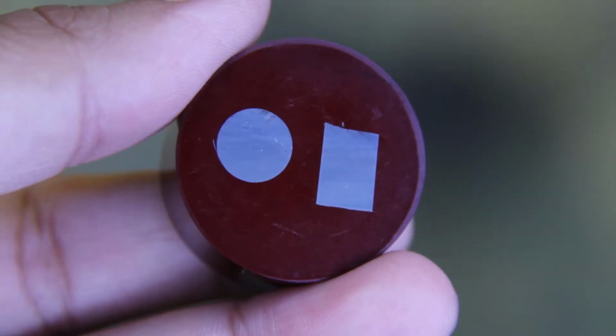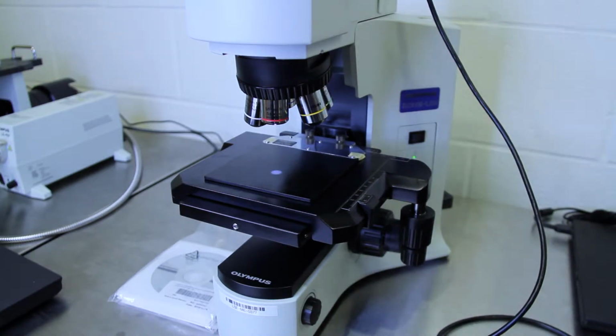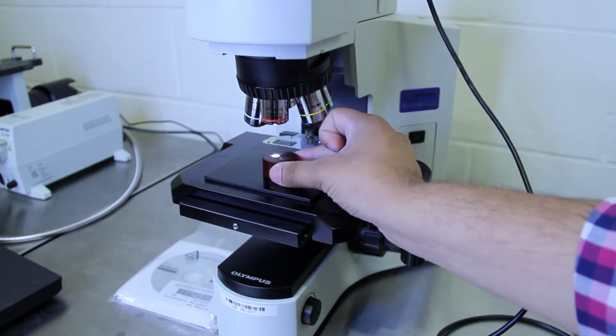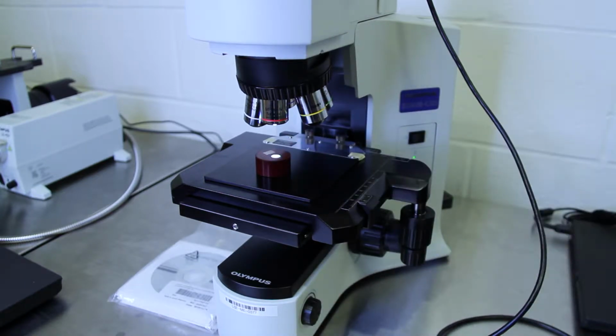So a microscope is used to view a sample at a very high magnification. So you're probably going to be using it on something like this, which you'll probably make in your labs. So to start, what you want to do is turn on the microscope using the switch at the back. Then a little light will appear on the bed of the microscope. That's where you're going to place your sample so that you could view it in the microscope.